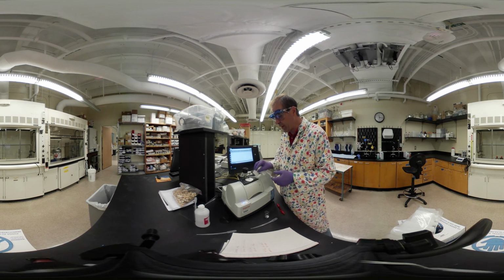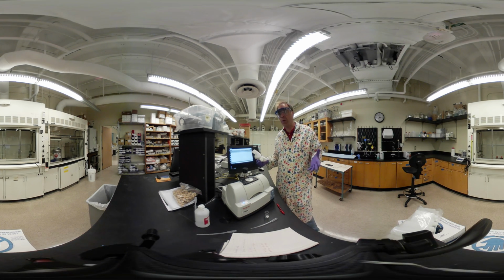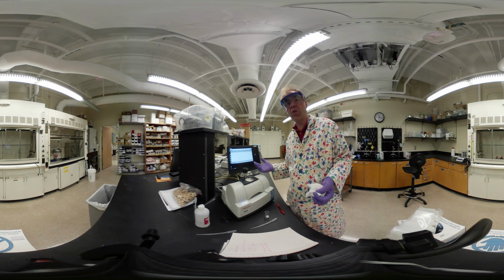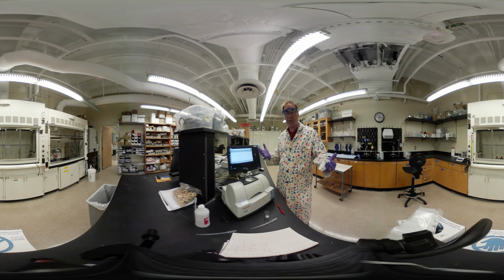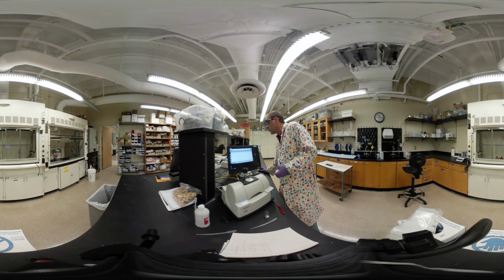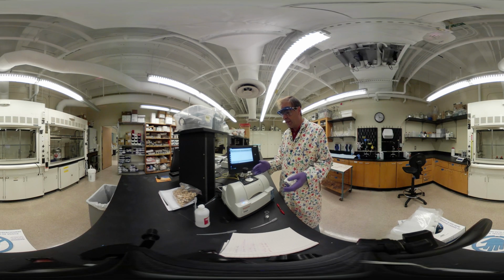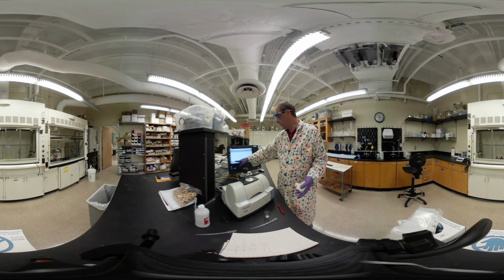Now we have to think about this a little bit in that the air around us has molecules such as water and carbon dioxide that can absorb in the infrared region as well. And we don't want the instrument to look at that. So essentially, we need to set the blank, just like you did for visible. Here, we actually call it a background. So I'm going to tell it to collect a background sample. What it's doing is looking at anything that can be absorbed just from the air. It's going to take 16 scans, and it's going to average those.